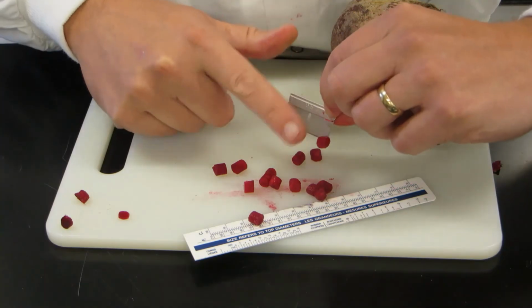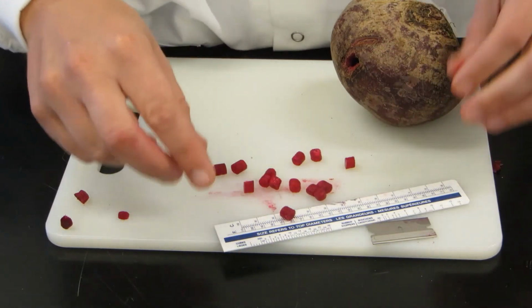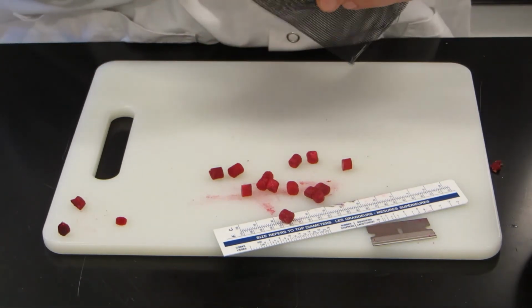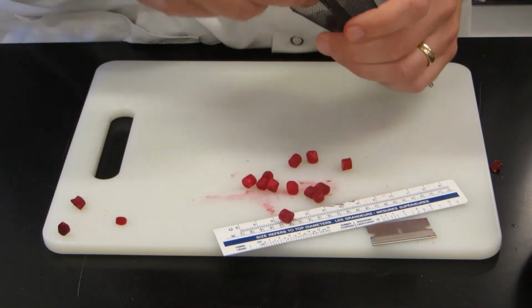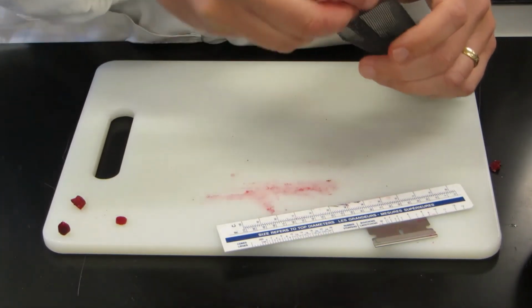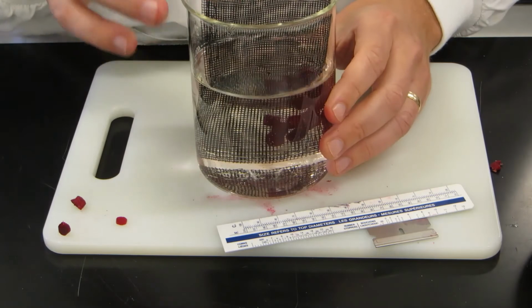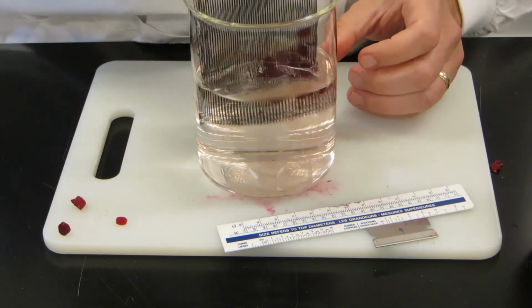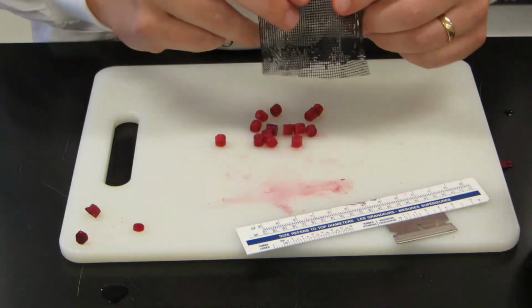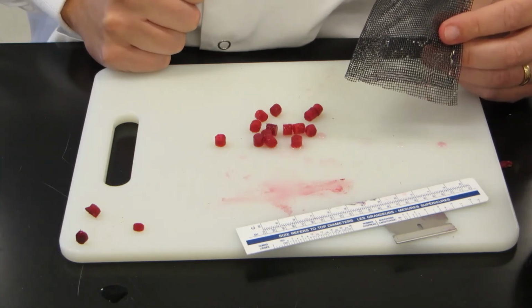So there are my beetroot discs. The last thing I need to do, you can see I'm getting a lot of the pigment all over my fingers, and there's going to be a little bit of leakage of this pigment. So what I'm going to do is wash them. So I have this little bag that we've made just out of screen. These beetroot discs are going to go into the bag, and what I'm going to do is rinse them in water for about 10 minutes. You can see already some of the pigment is leaking out, and after the 10 minutes this should be quite clean. So here they are, the beetroot discs are now finished being washed, and now they're ready for the temperature and solvent experiments.